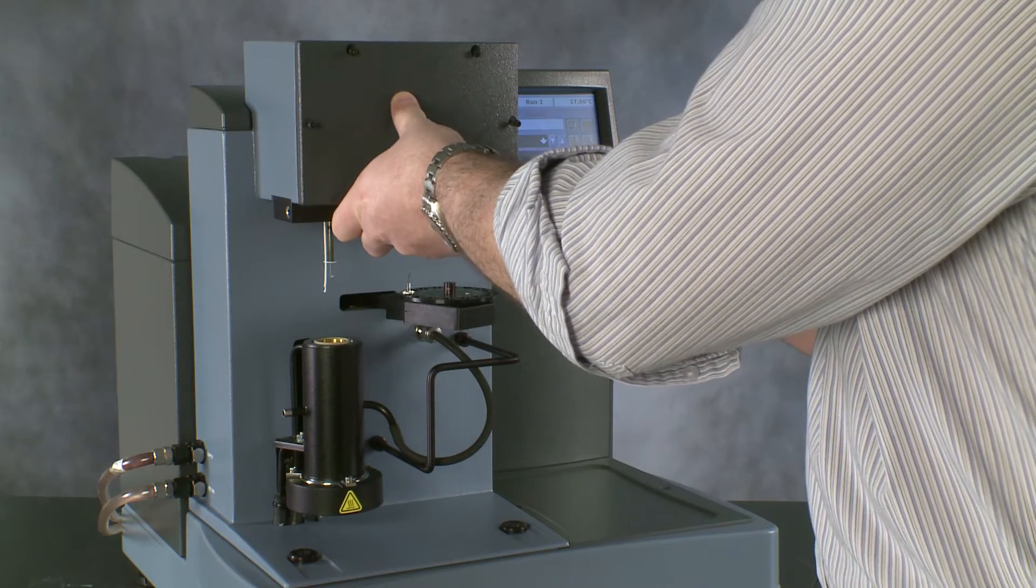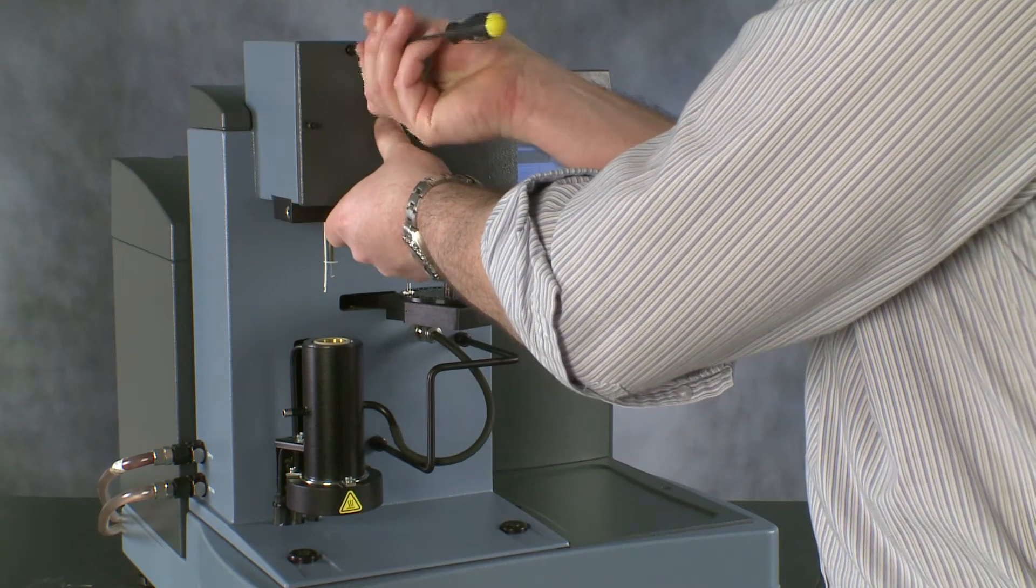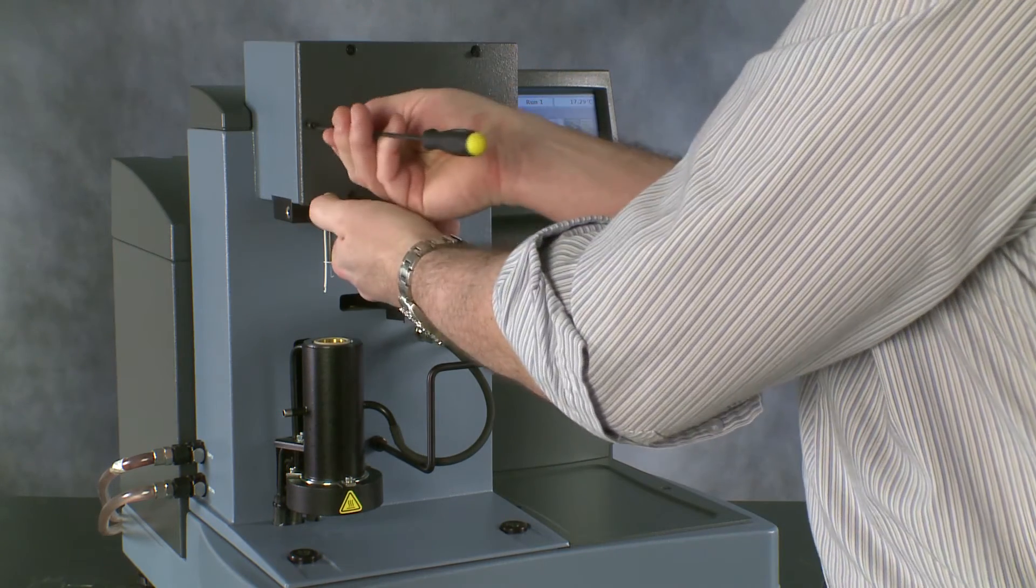When we replace these screws, we want to make sure that they're nipped up so we get a good seal on the balance housing.